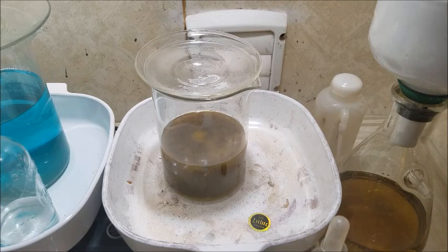Well, I'm not even sure what our yield's going to be here, if there's going to be much of any. Some of the gold's going to get trapped in those silver molecules there, in the silver chlorides. Some's going to be in solution, but why don't we test real quick? Let's do a quick test for gold in solution and make sure that we even have some.